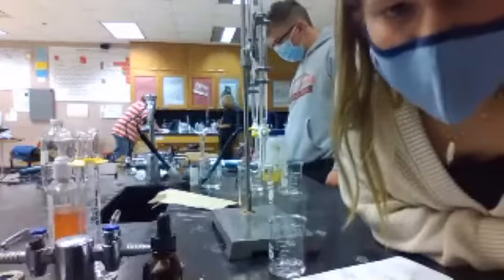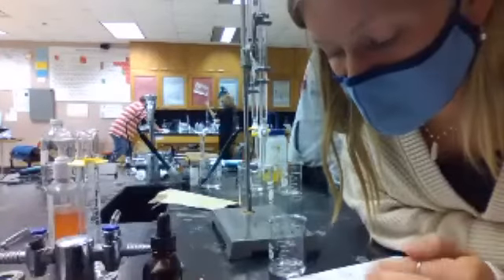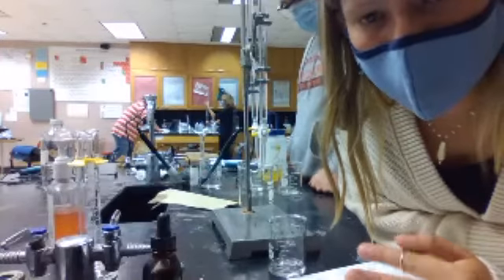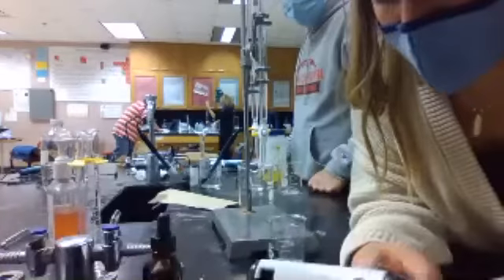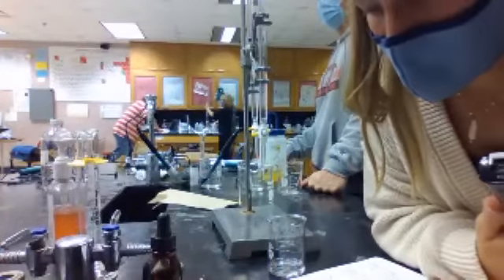So the VB is 9.89. Wait, the VB for which one? Now we're on trial number 2. I'm on 1. For acid or base? 9.8. Why not 8.9 if we're subtracting? I don't know, that's what my calculator said. When you did 9.99 minus 0.1, 0.19. Oh, 0.19. The initial volume is 0.19. Okay. Yeah, it's HCl.